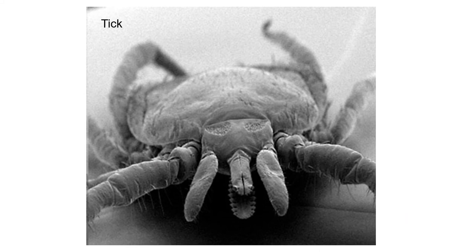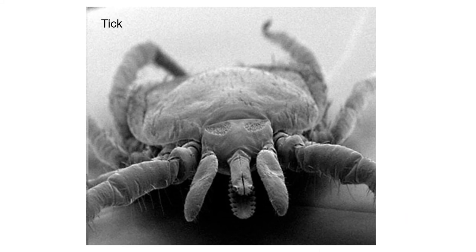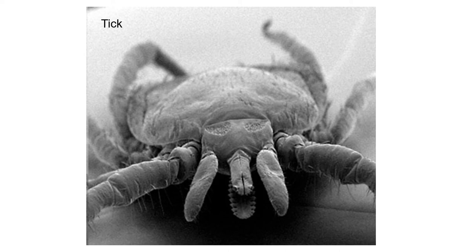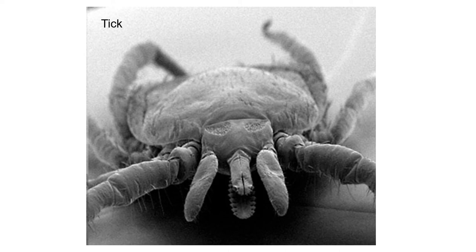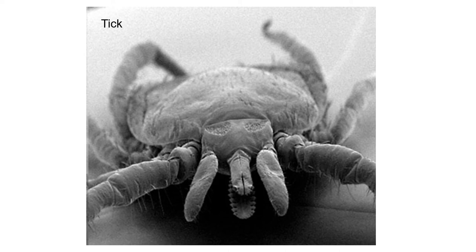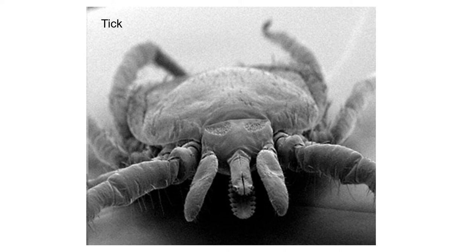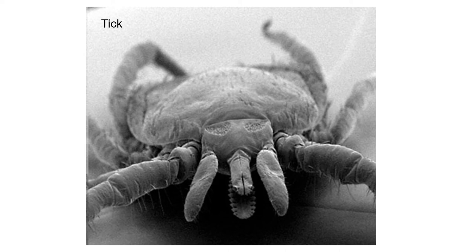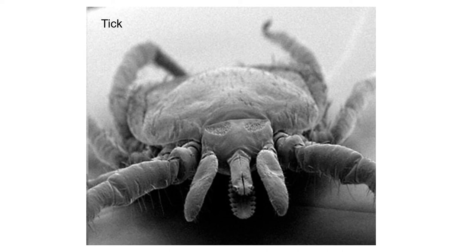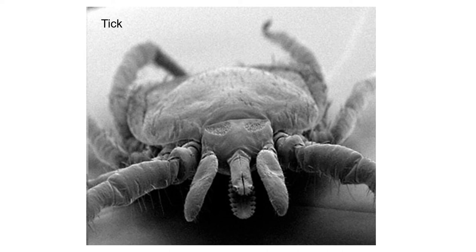One last scanning electron image: a tick. That structure in the middle that looks like a beak actually functions like one — with teeth-like structures it uses like a serrated knife to cut into your skin and feed on your blood.